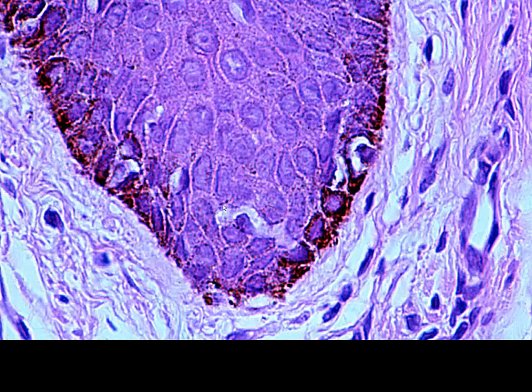So here we see a slide of one of those epidermal papillae. Again, our spinosal cells, our basal cells, and all of these dark granules are melanosomes. Most of the cells you see are the keratinocytes, and then this cell that's got the melanosomes as well, that's going to be our melanocyte.